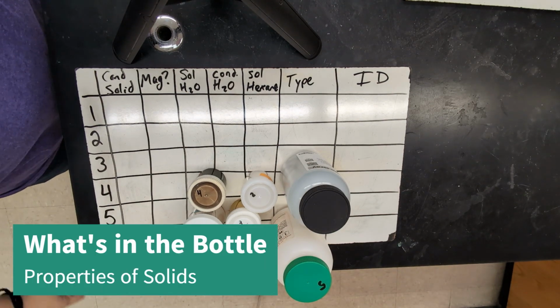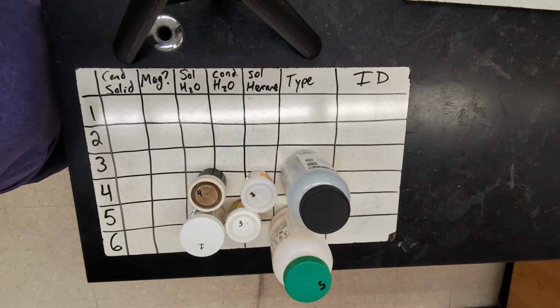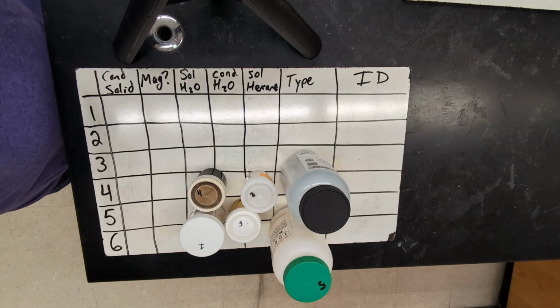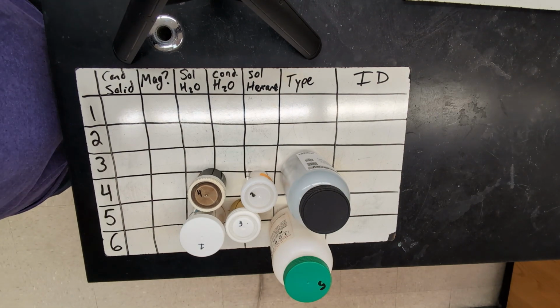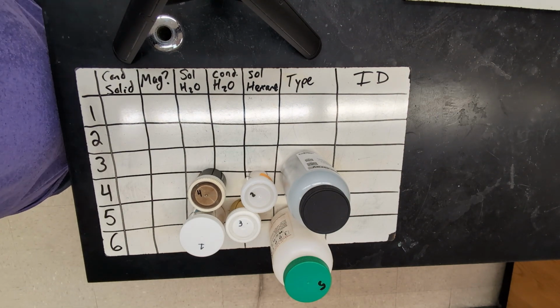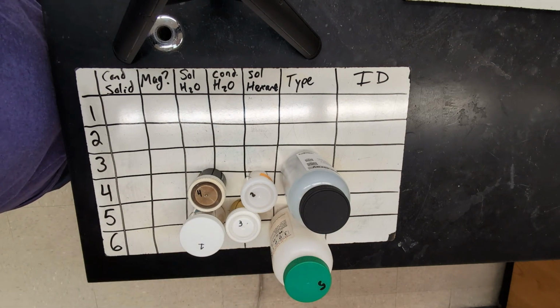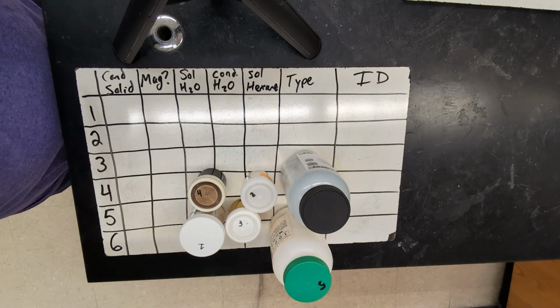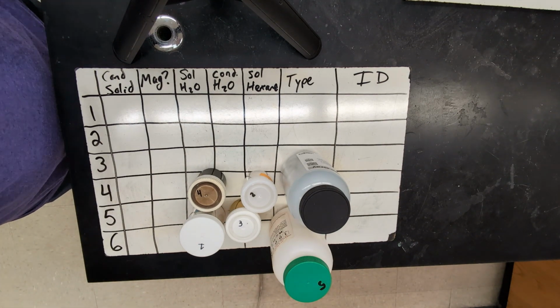Hello, today we're going to be doing the What's in That Bottle lab, where we're going to use physical properties of different compounds to try to figure out what type of solid it is by performing a variety of different tests. So I have 6 compounds that we're going to test today. I know what they are, but in theory, your students would not know what these compounds are before you start.